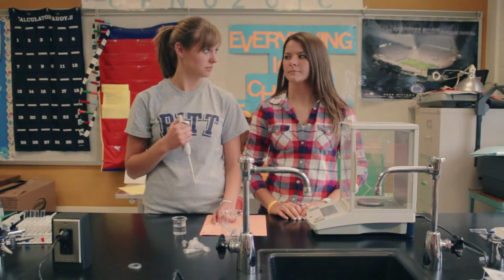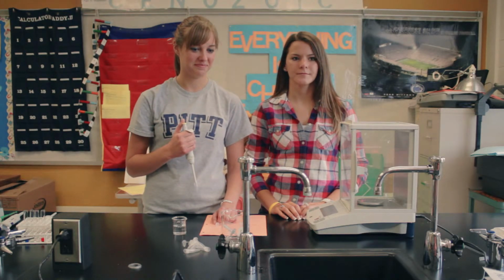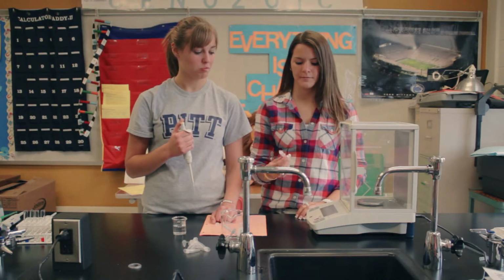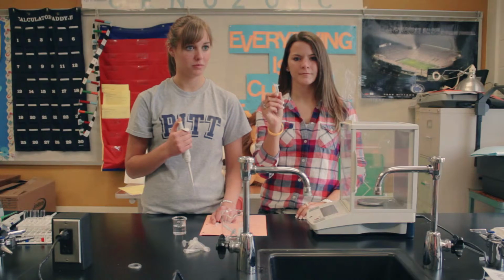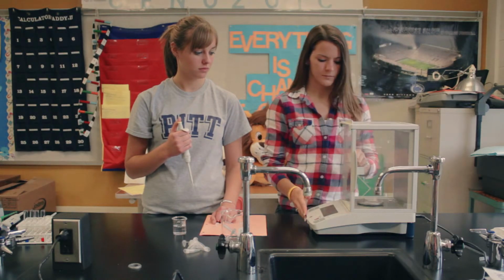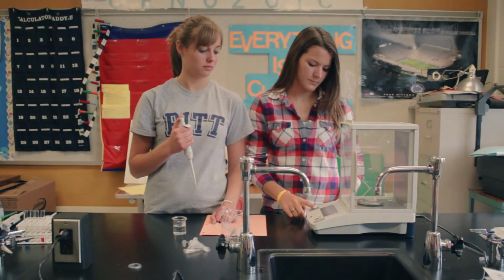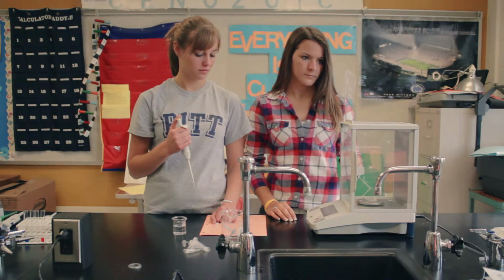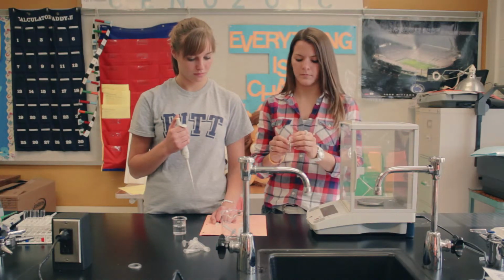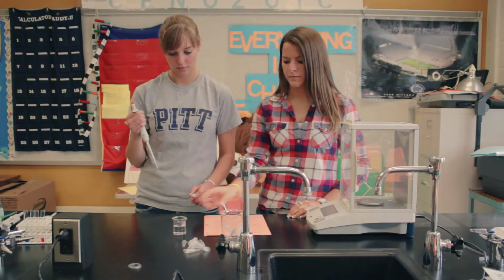So now we're going to run a demo for the lab that you're actually going to do with the micropipettes. First thing you want to do is obtain one 1.5 milliliter microcentrifuge tube, and you want to mass it using the analytical balance. So just slide back the door, put your sample in, and make sure you zero it with the empty microcentrifuge tube in there. Then you're going to pour about 15 milliliters of distilled water into a small beaker, which Maggie has right here.